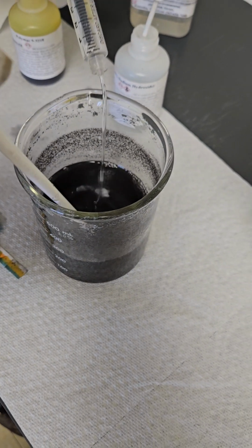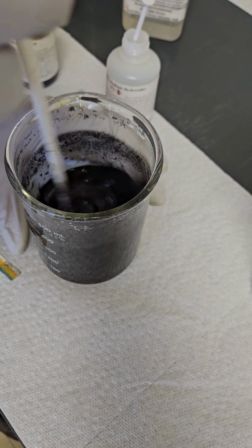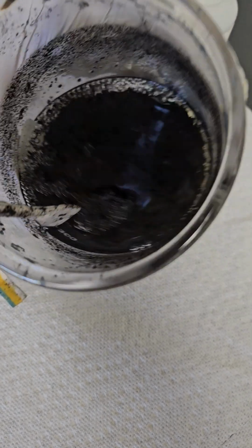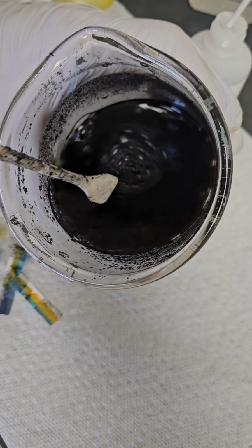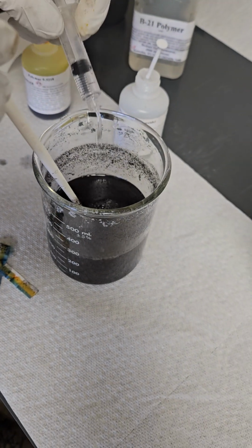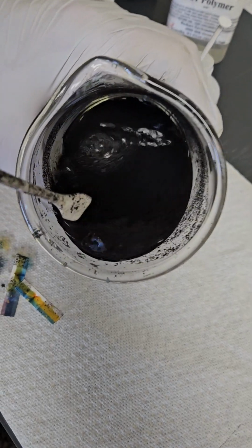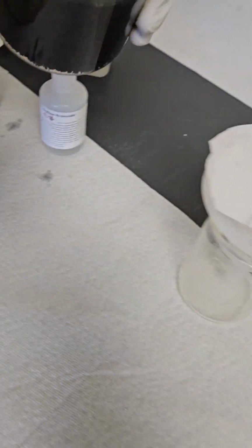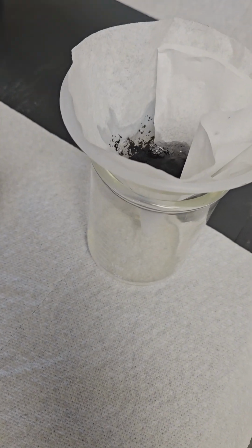Now just the polymer. This is a diluted polymer to flock it up. And I got a good treatment there. If I needed some more diluted polymer until we get a nice size flock going, and then we'll just pour it to filter to see what our clarity is after going through a filter press.